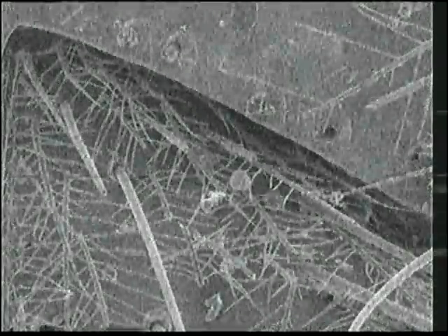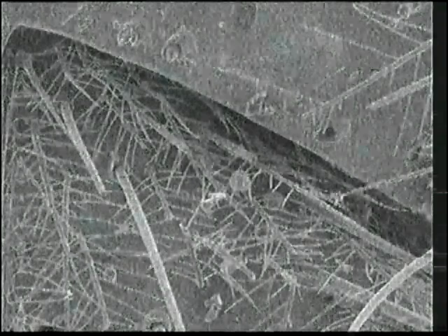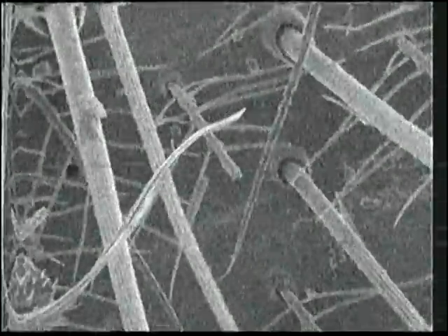And yes, the image is jumping, but the fact is that it's not jumping on the SEM monitor. It's only doing that on the computer because it's having problems syncing somehow. So we zoom in, you can see the hairs on the leg, and you can see where the hairs come out of the legs, right here, like that. That's a hair growing out of a spider leg, and the hairs have striations on them, as you can see.